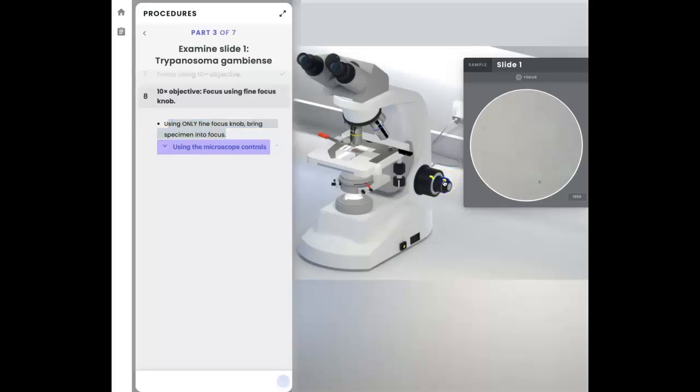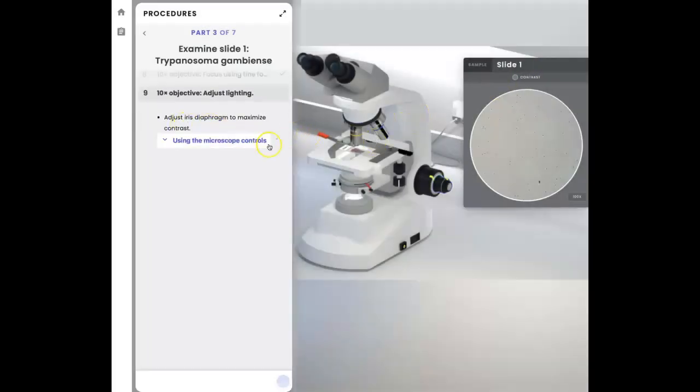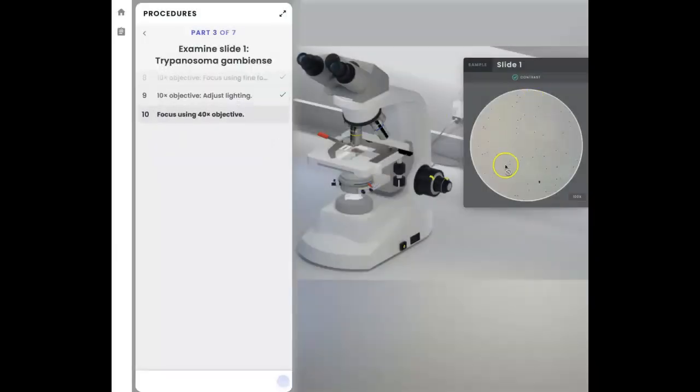Okay, so here I go, turning one way. I see that I'm going in the right direction because I see something on the screen, on the actual field of, what is it called? The field of view. So I'm going to keep going until I see a check mark. Keep going a little bit more, and there is a check mark. So now they want again to adjust the iris for contrast. So less light doesn't work, more light, and there is a check mark. So we're done with that.